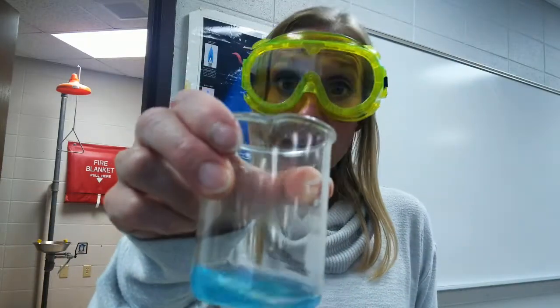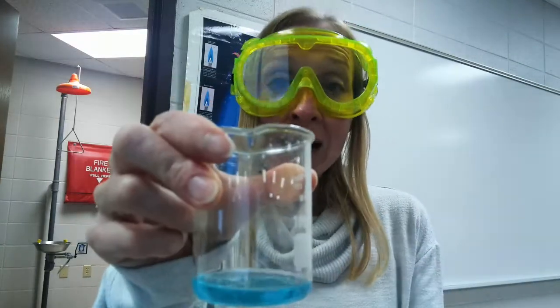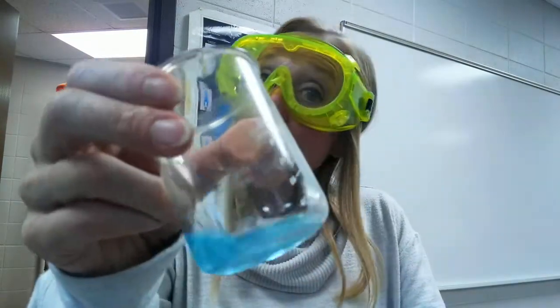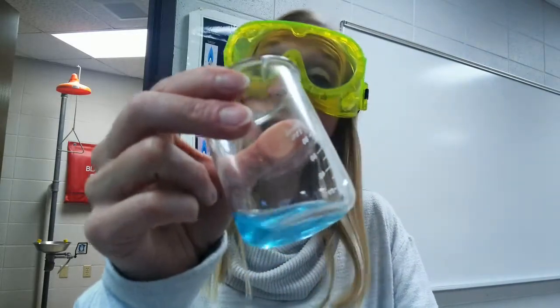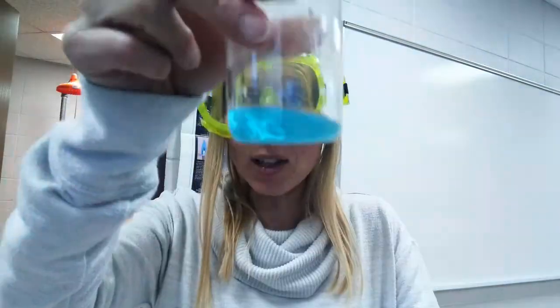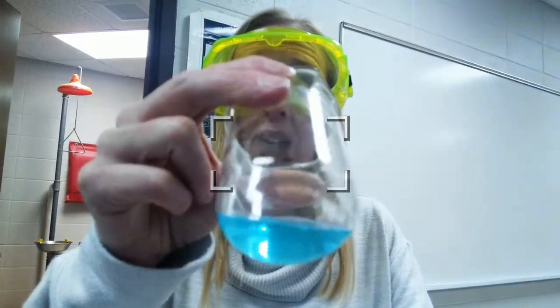Now, there are three main components of this solution. The blue color is copper ions. It's copper +2 ions that formed by reacting with the nitric acid. There are colorless silver +1 ions in here. And there's some excess nitric acid. We wanted to make sure that we used enough acid to totally react the dime. I didn't want there to be any pieces of solid left over today. And we did good. It's gone, and it's just beautiful. That copper solution is so cool, isn't it?